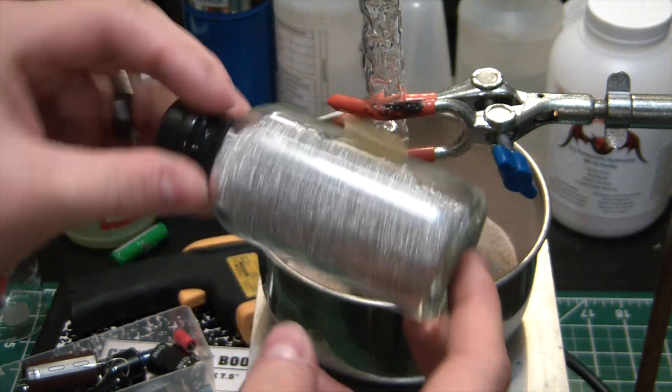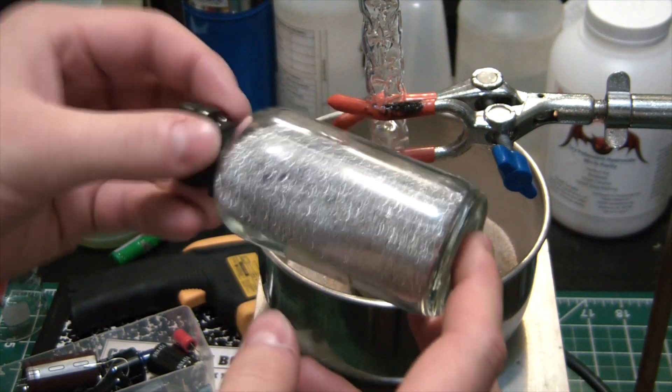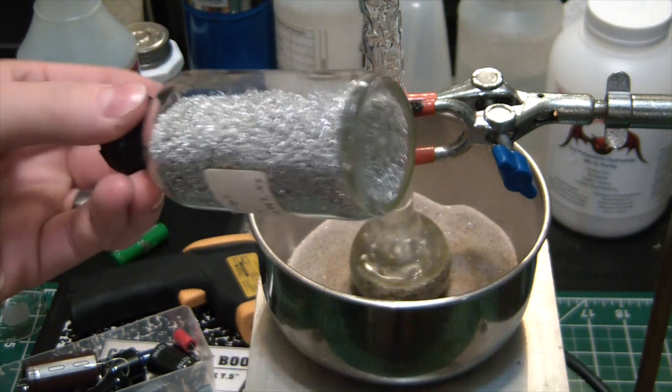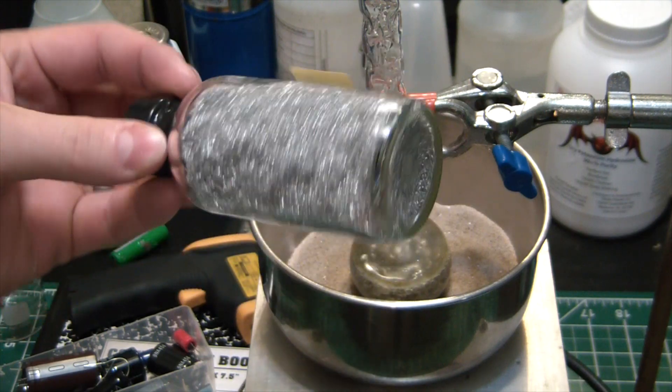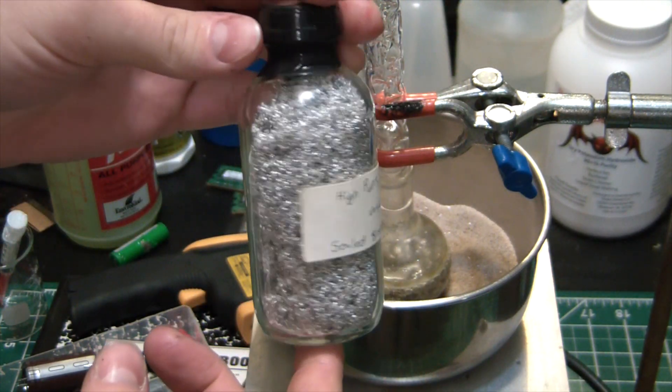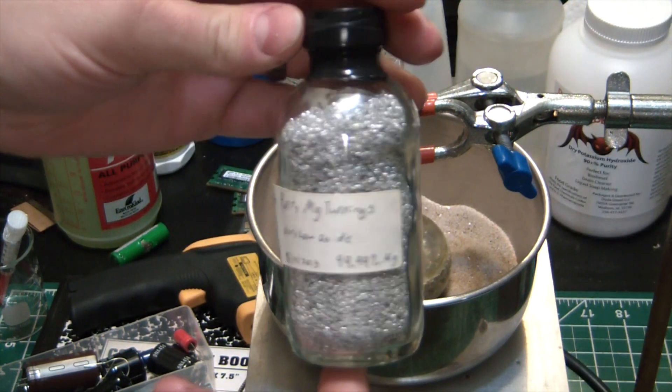So maybe I'll have to do another batch and do some fresh magnesium turnings right before the reaction, make sure they work. I've done this reaction before several times in the past and been successful, so I was pretty surprised this one didn't work out.